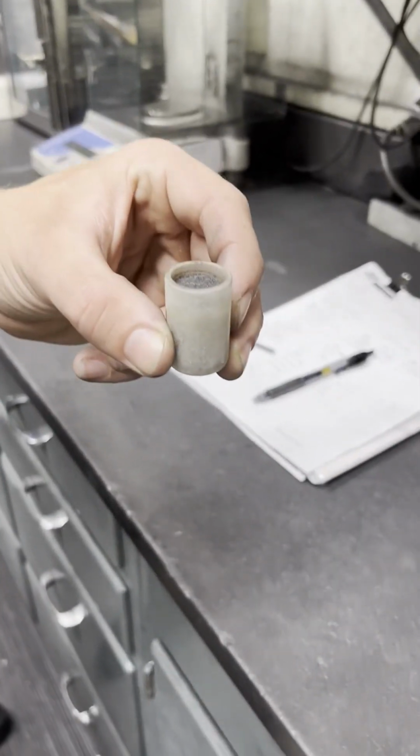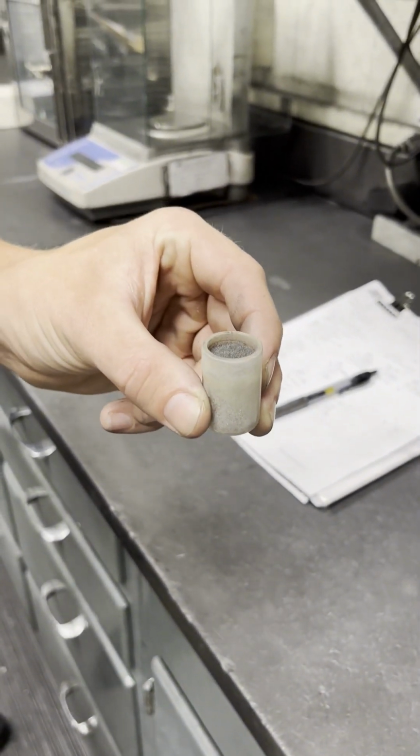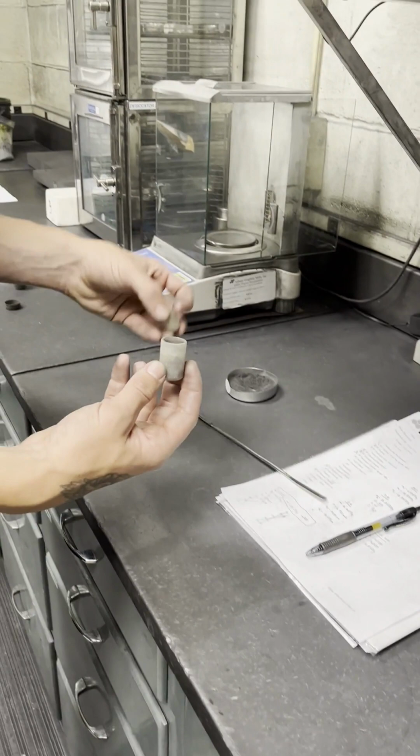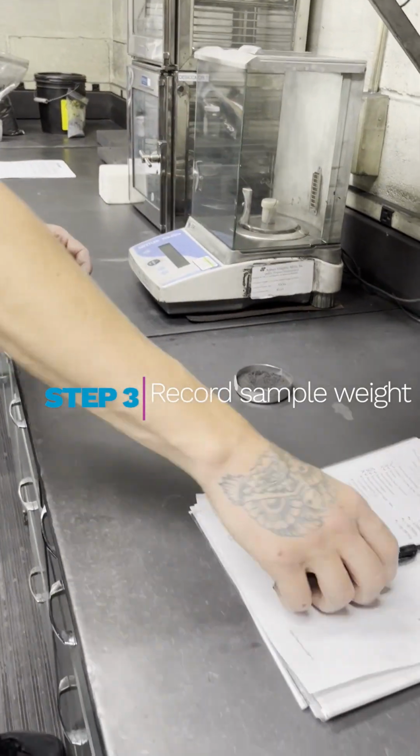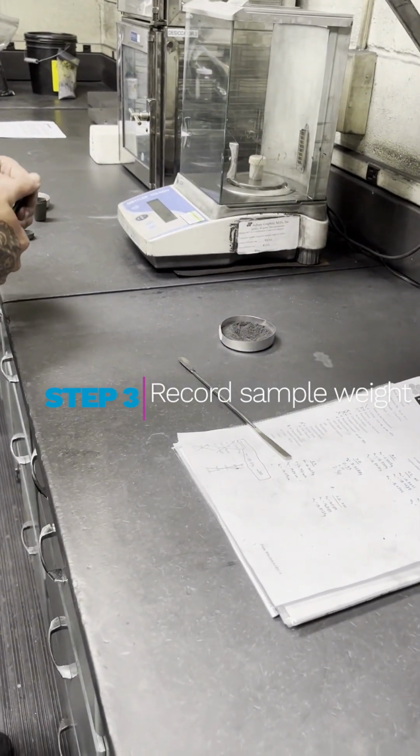So you can see it's very close to the top. It's not up to the brim, but it's close enough. You're going to put the lid back on, and you're going to record this weight on the scale once it's stable.